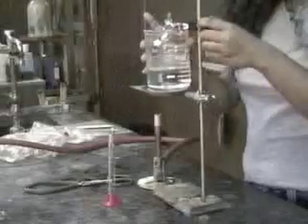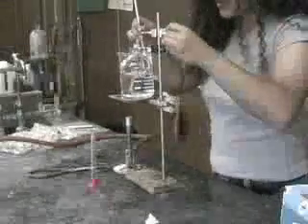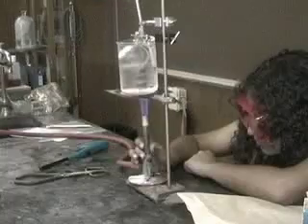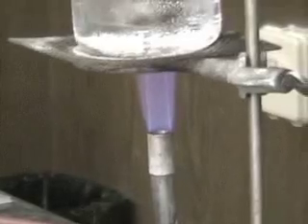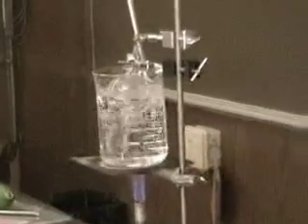We set up a hot water bath and put the flask in it, so the volatile liquid will turn to a gas. We use a thermometer to measure the temperature of the hot water bath, so we know the temperature of the gas. We heat the water to boiling, allowing the volatile liquid to turn completely to a gas. We use boiling chips in the hot water bath to ensure even heating.